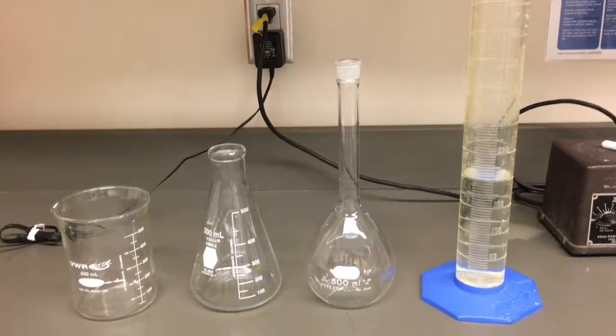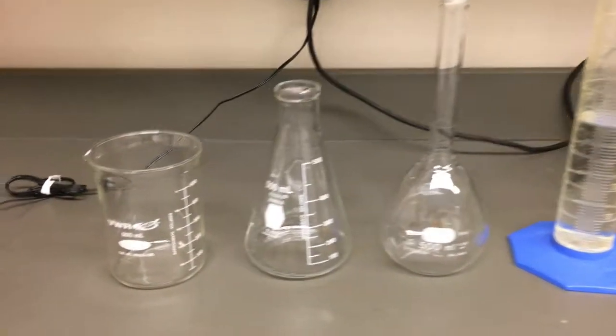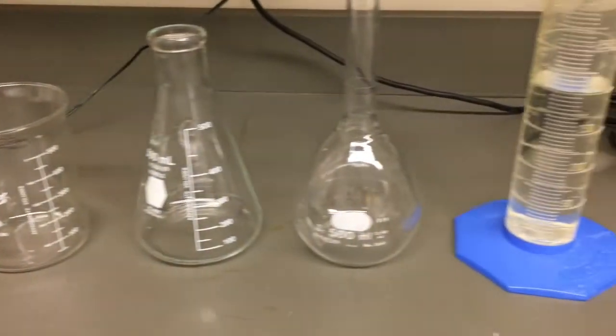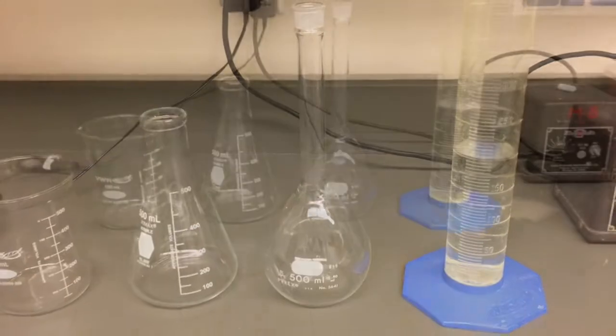To begin, select the appropriate glassware for preparing your media. You will often have the option of using beakers, Erlenmeyer flasks, volumetric flasks, or graduated cylinders but not all are applicable.